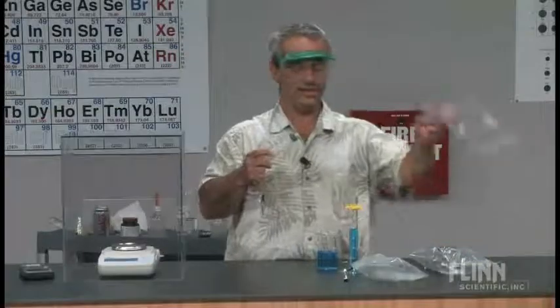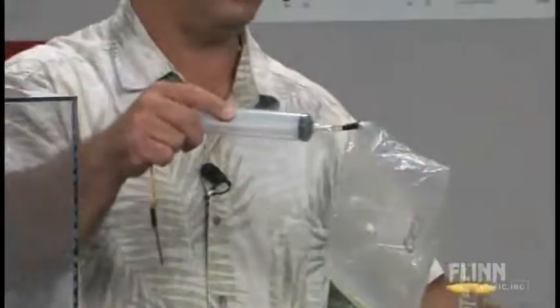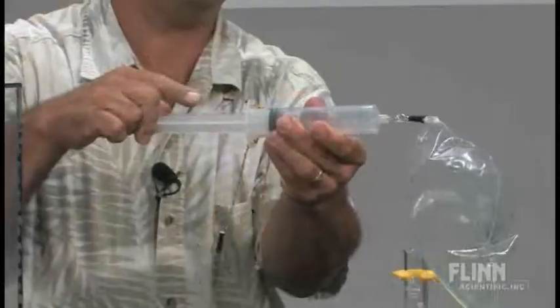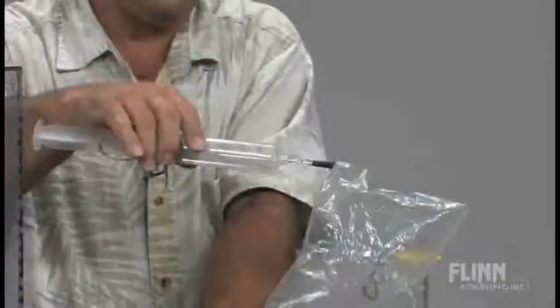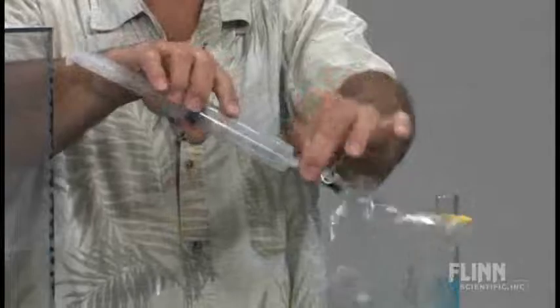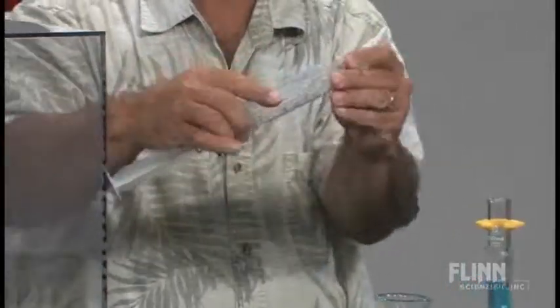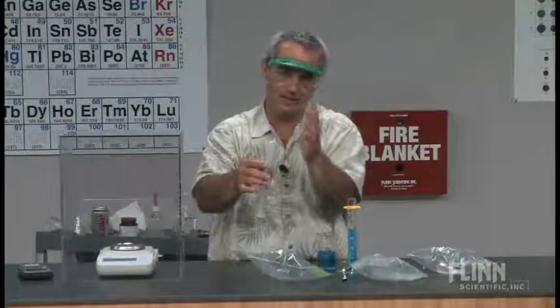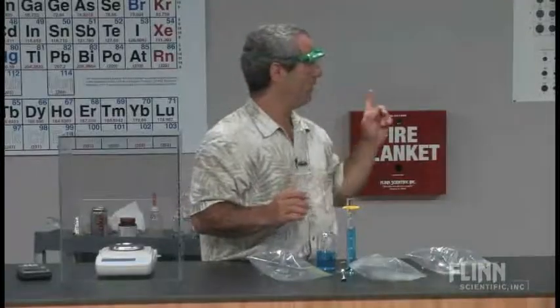I'll go to sample B. Same technique. Open the pinch clamp. This one I'll just put down here. Pull it out. Set the nail in. Push it right there so it's just like it was before. Pinch clamp back on. It's a nice little technique to learn. Disconnect it. Put the cap on there. I know, some air leaked in or out during that time. There's some error sources, it's not perfect. But let's see if we get a different mass this time, hopefully.